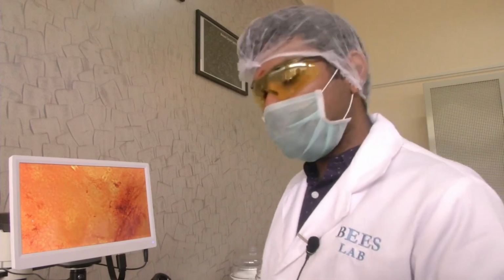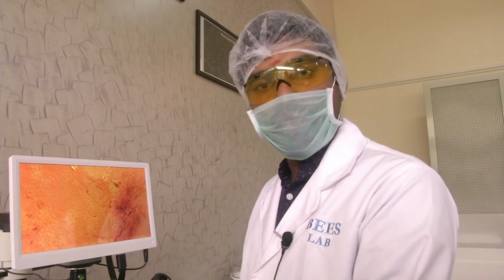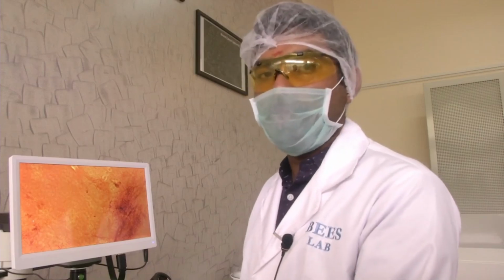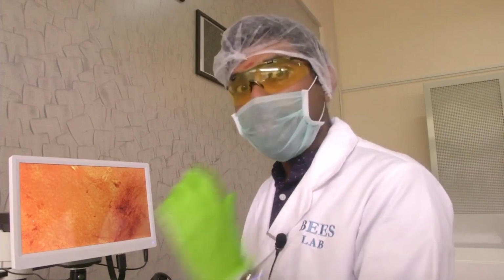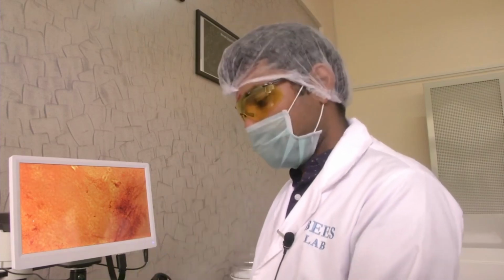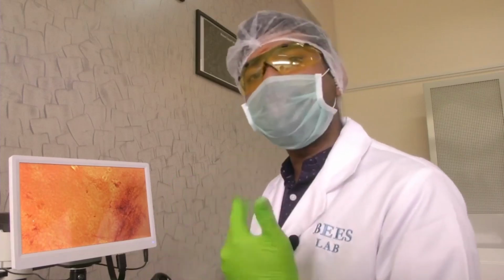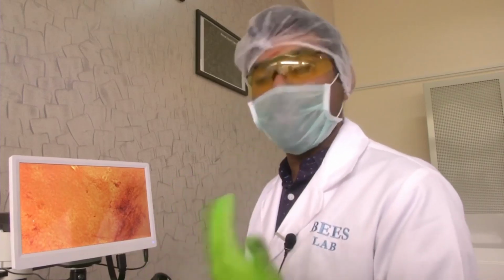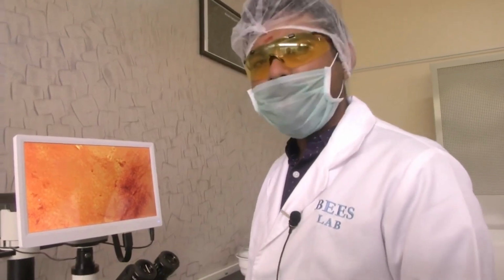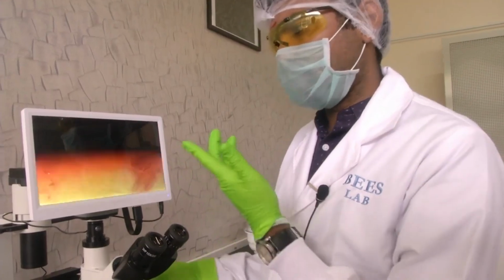So folks, these are the main principles of the inverted microscope. You have understood what is the difference between an inverted microscope and a normal compound microscope. Why is it so important in biological applications? How we can take images, and what are the different methods for which we need the use of an inverted microscope. There are other different knobs in this microscope which are not very important.